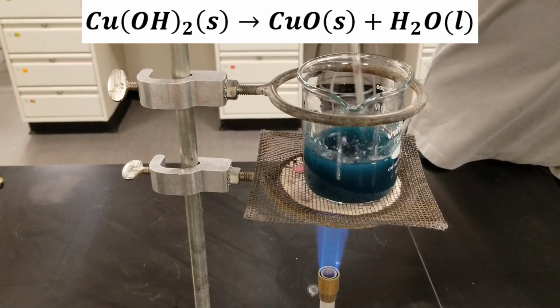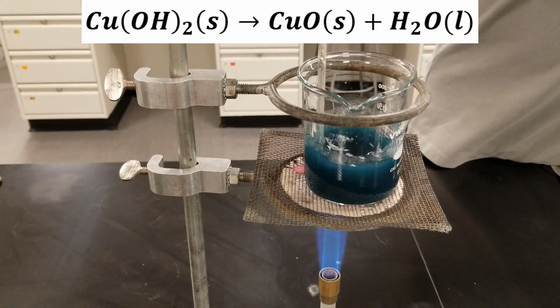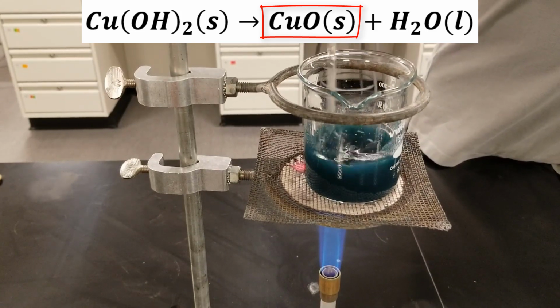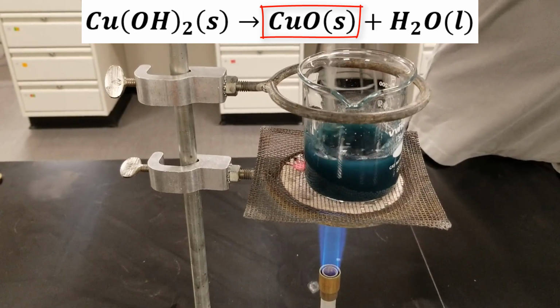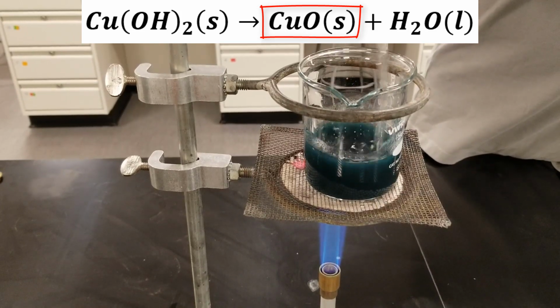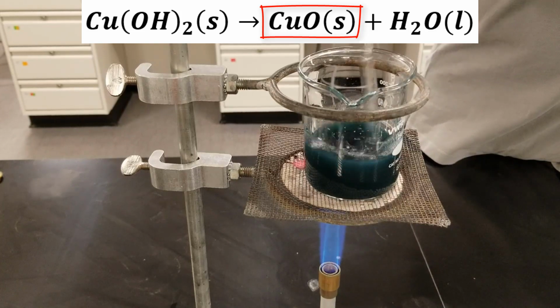You can see how as we're heating this, it's getting darker and darker. That's the blue copper hydroxide beginning to decompose and form the black copper oxide.